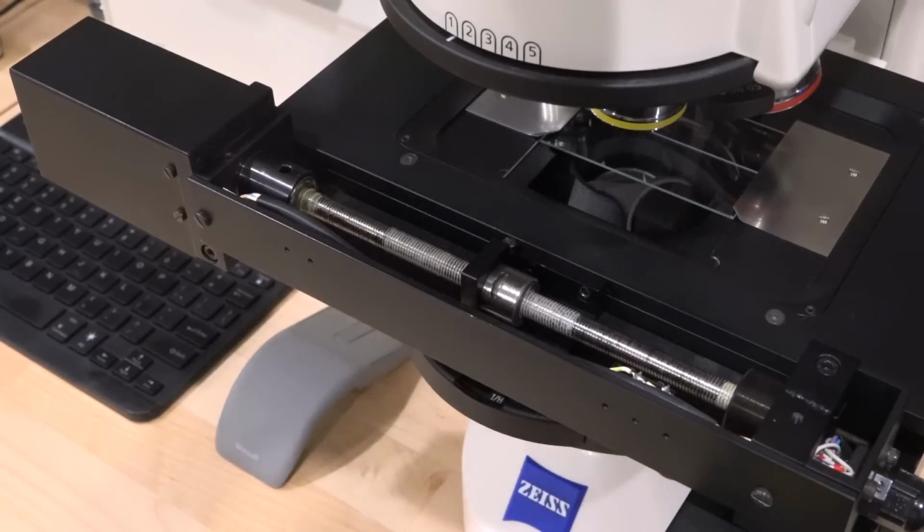Now, this had a lot of problems. I had to spend many hours taking it completely apart and putting it back together. It was actually put together incorrectly. It looks like someone else had tried to mess with it at some point, and it was missing a bunch of screws.